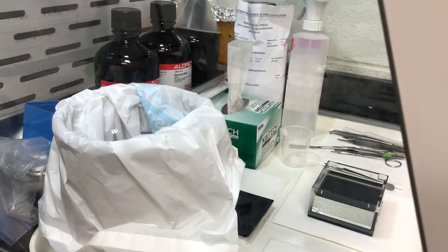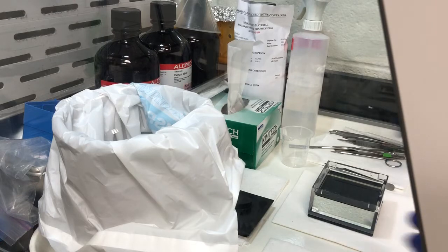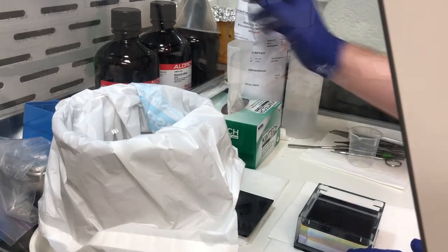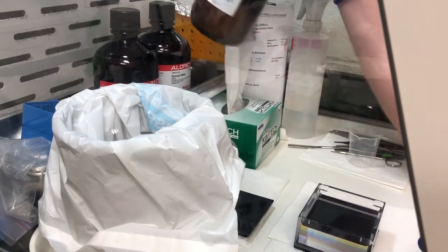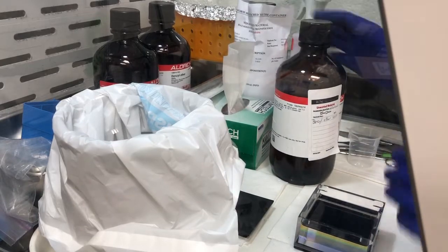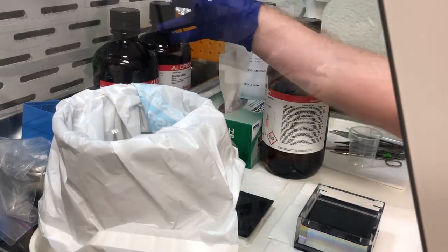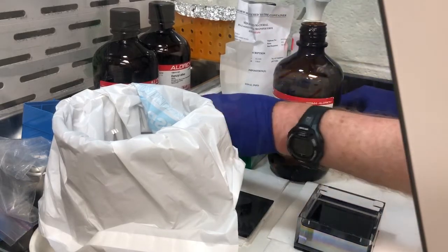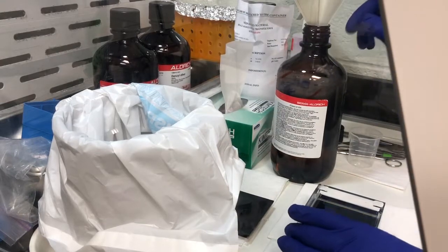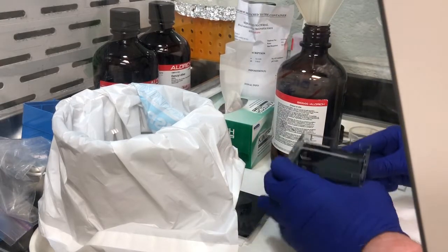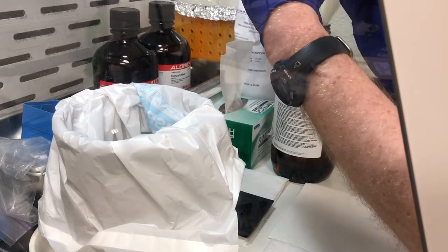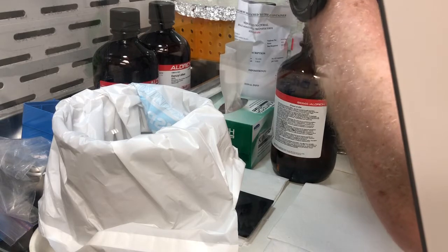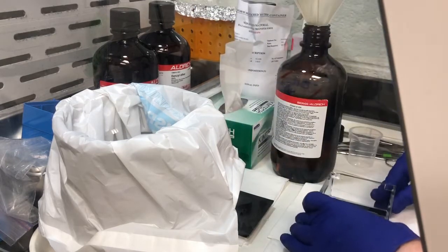To empty this, I make a little bit of room here. We always do this in the hood. We have our waste bottle properly tagged. This is a new bottle, an empty that I haven't started filling with waste yet. I open this up, put the funnel there, and then this is kind of an uncomfortable maneuver, but you can manage, and then you just pour this out.